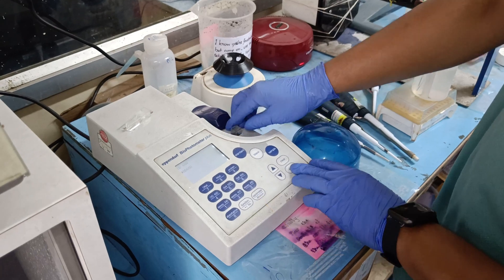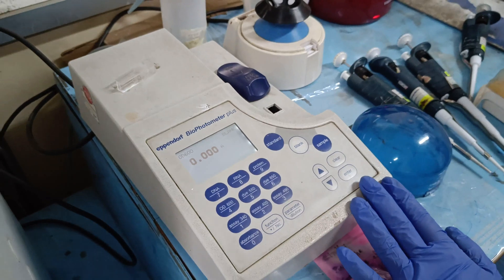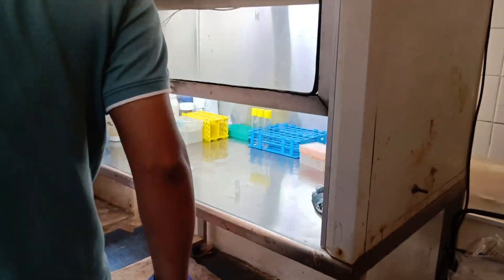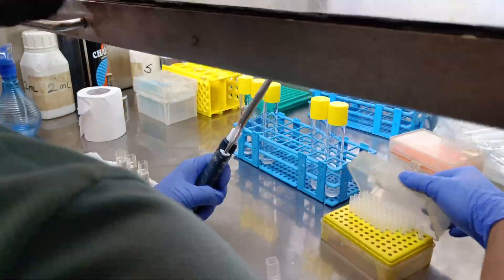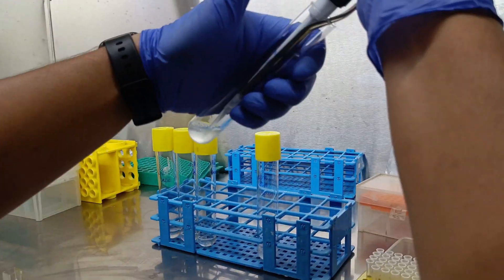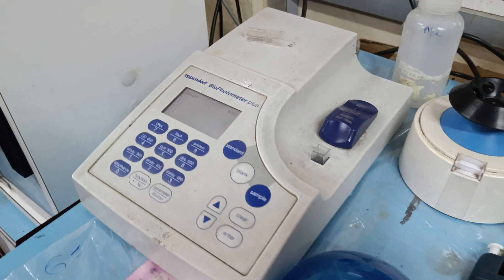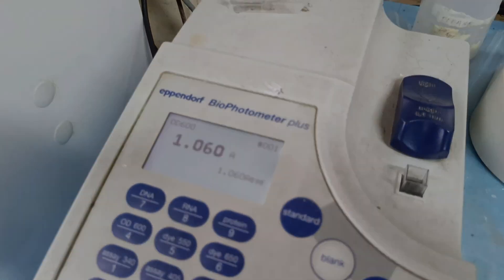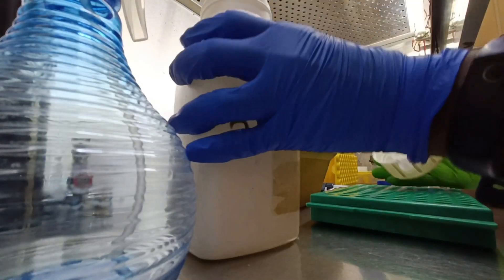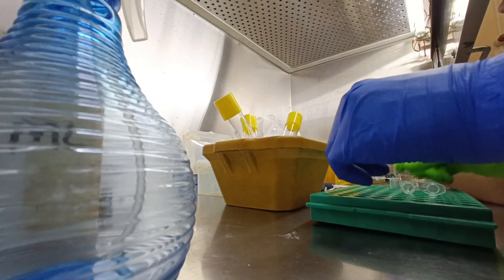As this is a very slow-growing bacteria, first we need to take water as a blank. Now we can measure the culture OD, which is around 1 — that is perfect to make competent cells.